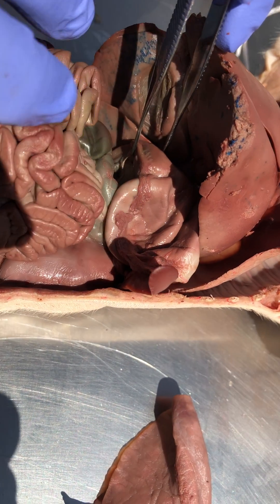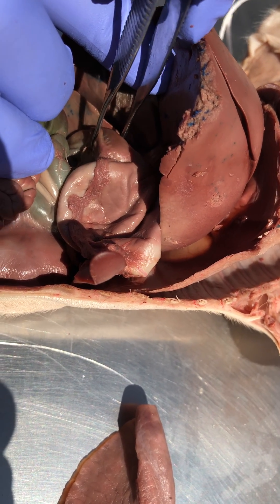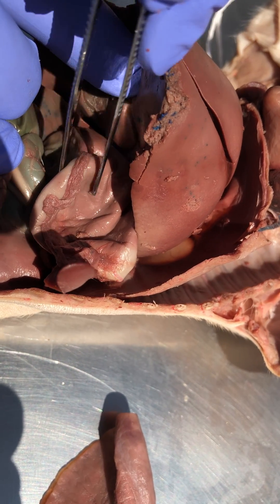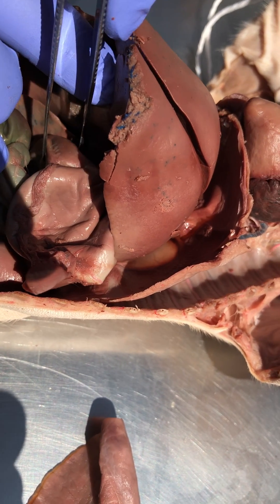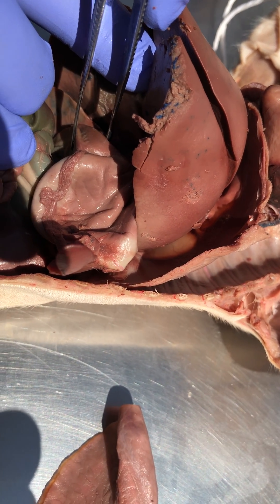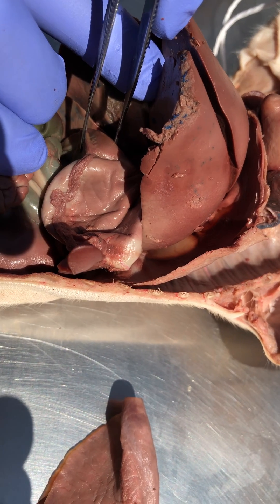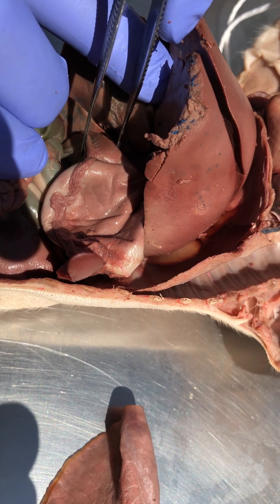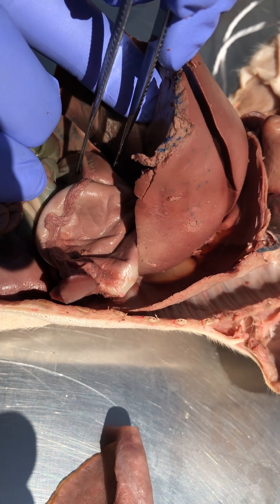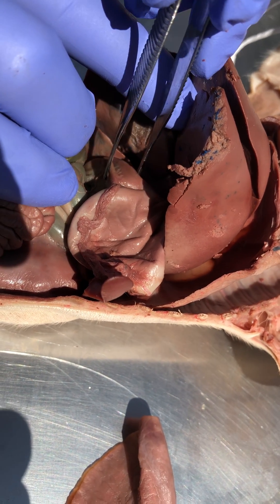I'm squeezing it — it might be shadowy — and it's not compressing, even though the stomach is super compressible, this is not, because it's a knot of smooth muscle. It's called the pyloric sphincter. Just like the round muscle around your lips that can purse your mouth closed, that sphincter will purse closed the exit from the stomach, controlling what passes through.